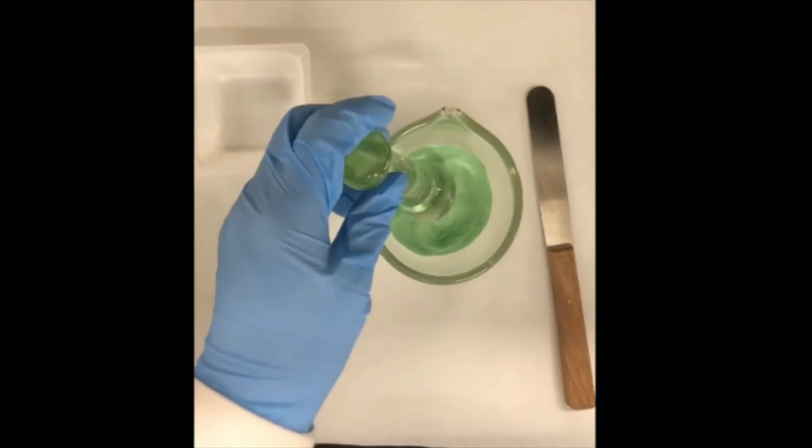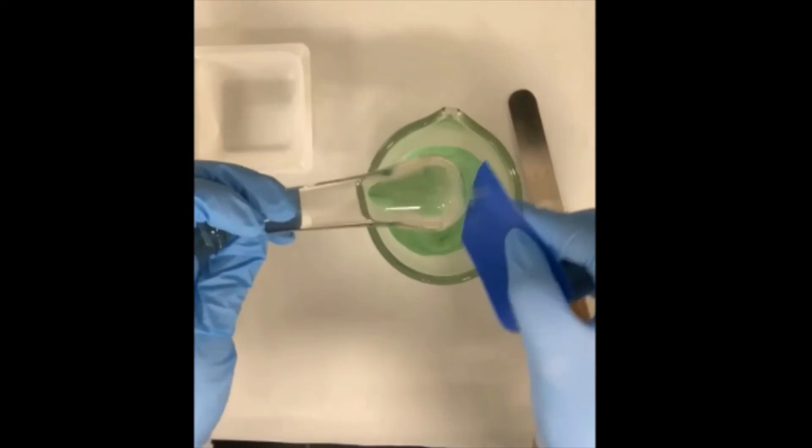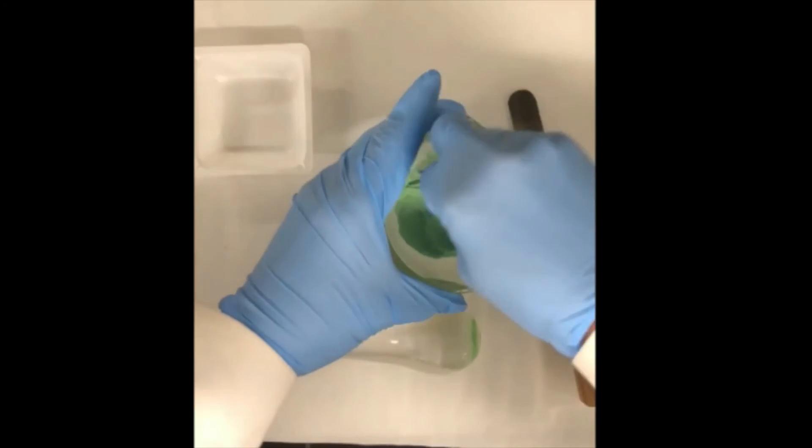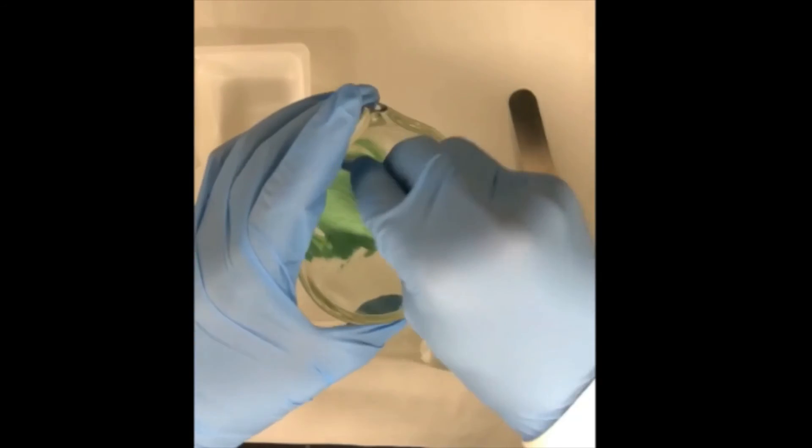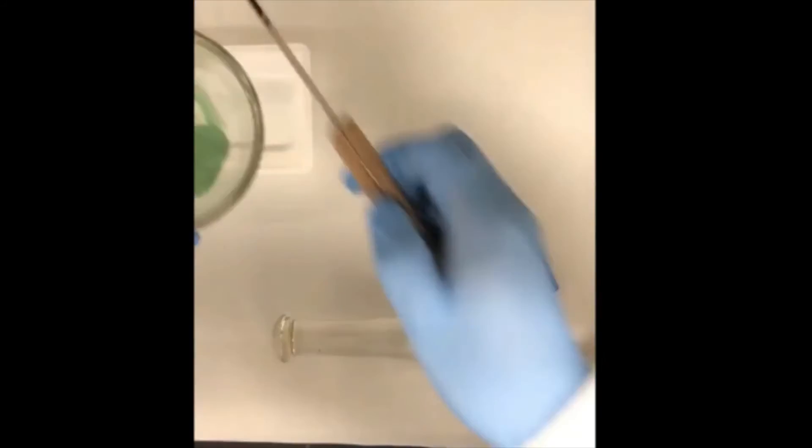Actually if you dump all the powder together at once, because the ratio of these two powders are so different, it will be very difficult to mix them uniformly.